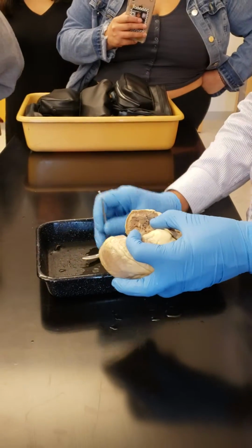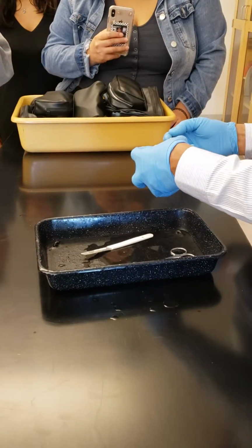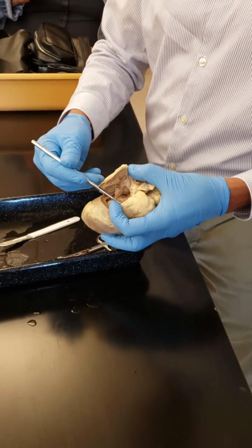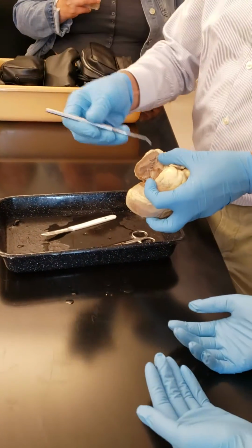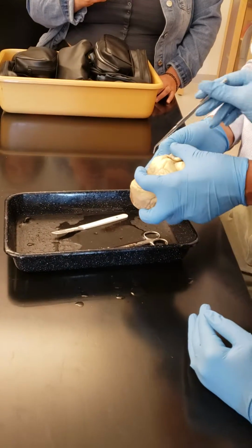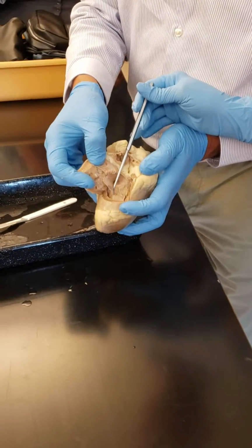Can you wear gloves? Go ahead. You see this valve here? Attached to threads, right? So this valve is tricuspid valve, and can you show it to this side? These are chordae tendineae. Yes, I'm holding this. See the thread-like things here? The chordae tendineae. You see that? All of you? Now, at the base of that, this muscle here, the papillary muscle.